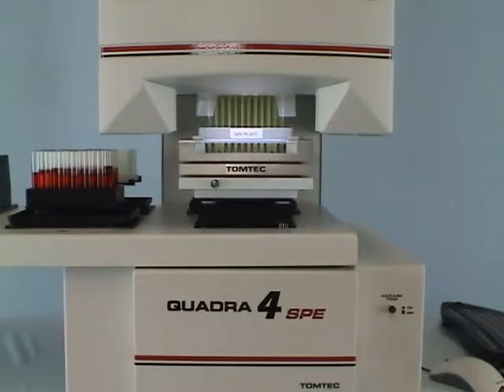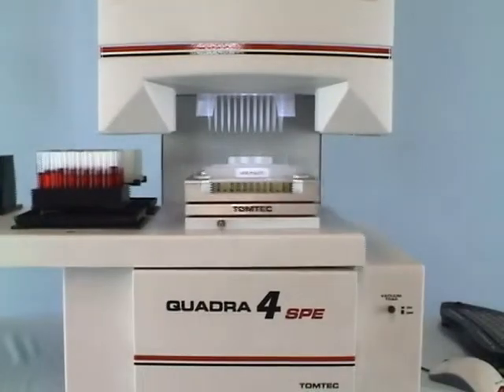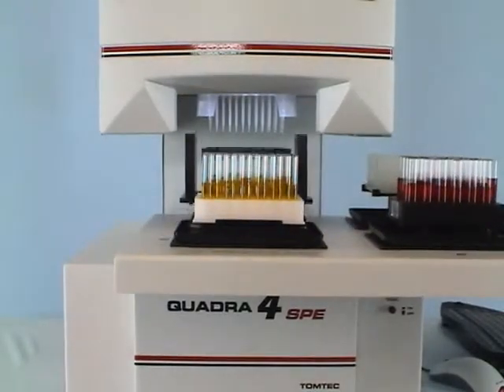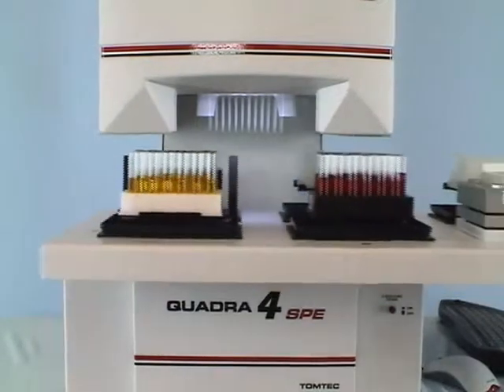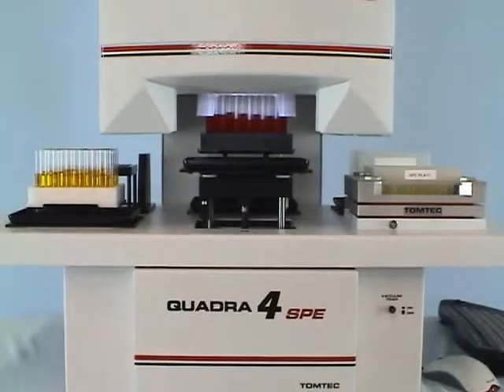The 450 microliter tips of the Quadra easily handle the reagent volumes that may be required for the method in use. The Quadra provides a unique method of blowing low air pressure through the Quadra tips under program control. This permits going from organic pipetting to aqueous pipetting without having to change tips. This is demonstrated on other TomTec DVDs.